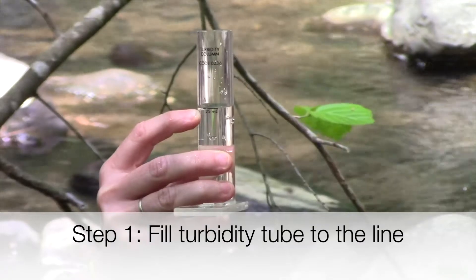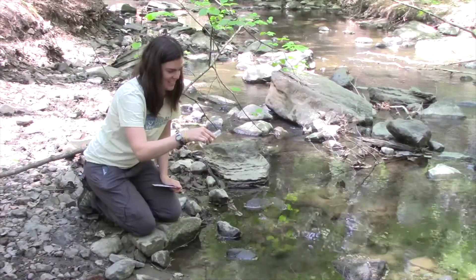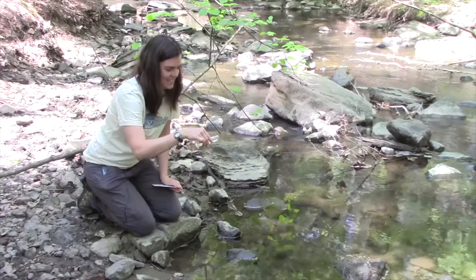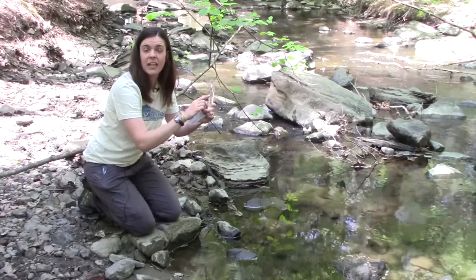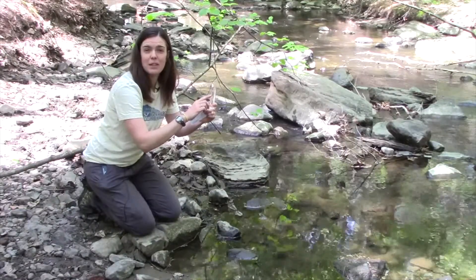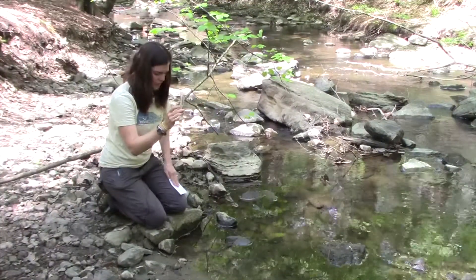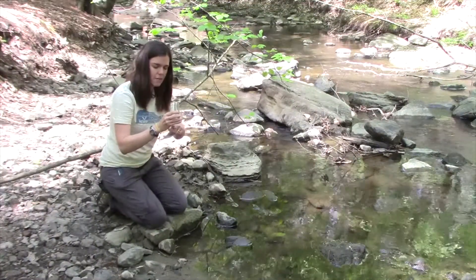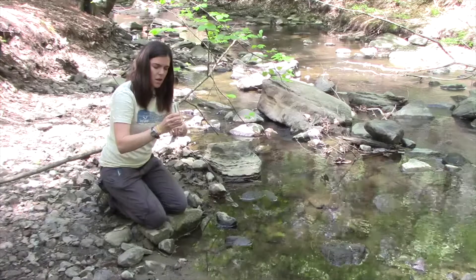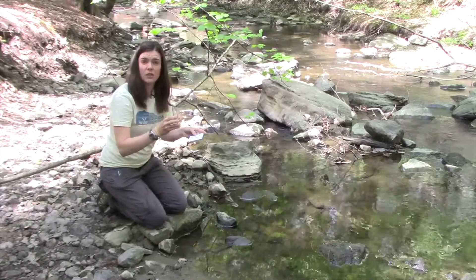The goal is to reach 25 milliliters. If you have too much, you can pour off the excess. If you go under that, start over again until you reach 25 milliliters. A nice little trick is to dry off the piece of paper as well as the bottom of the turbidity tube — that might help with the results as well.